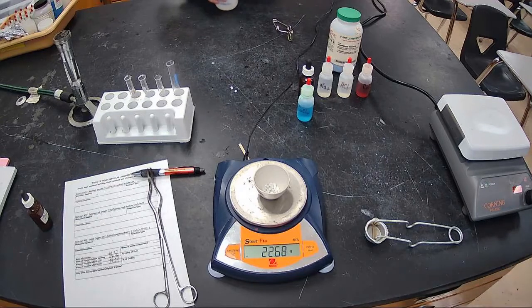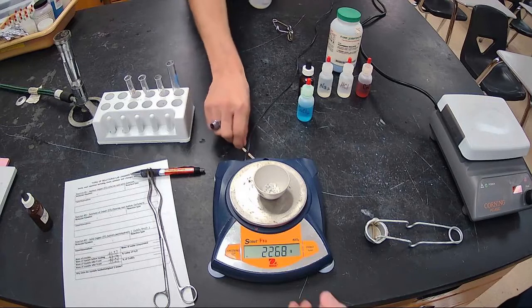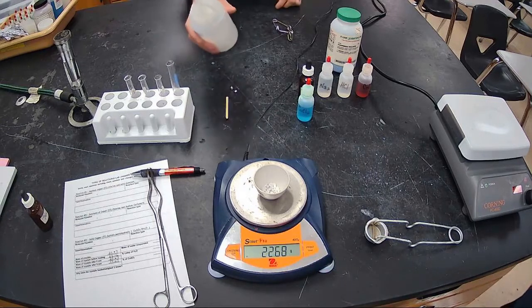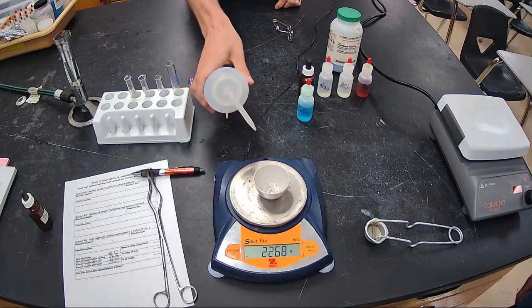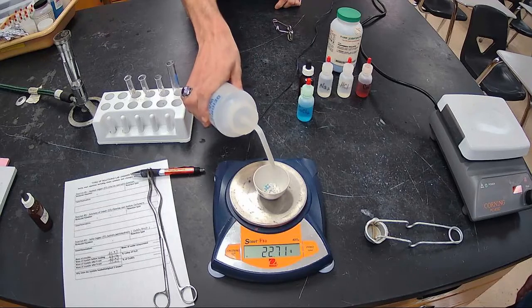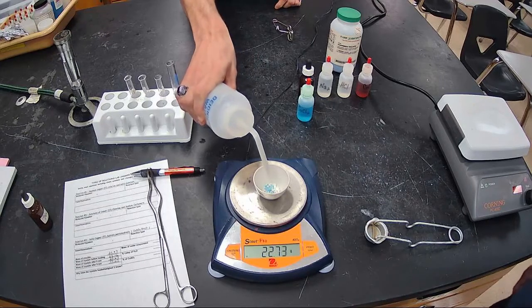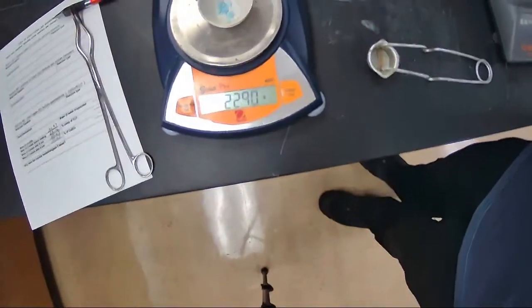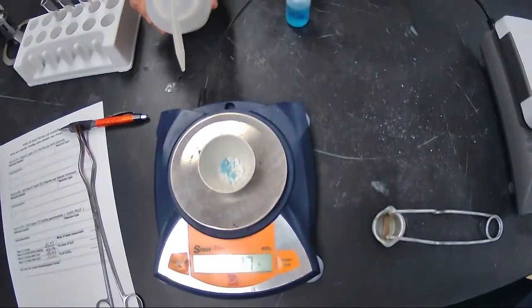And one little bonus before we wrap up: a lot of times we're taught that chemical reactions are not reversible. There are definitely a lot. Like, you can't really unburn this. So the wooden splint, it's burned, we can't get it back. But let's see right here. Let's try and see if we can put water back into our crucible and see what happens. Oh, look at what's happening. Happen to pick a bottle with the water in it.